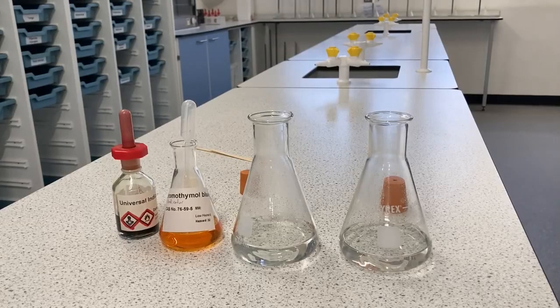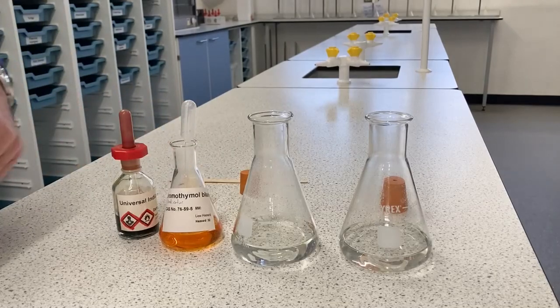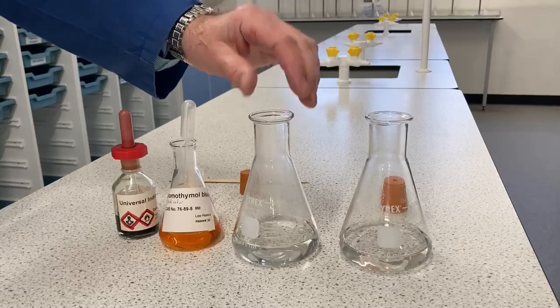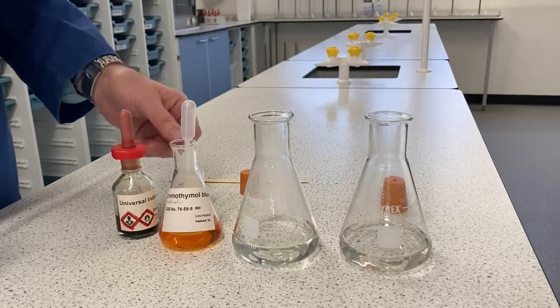In today's video, we're going to do some chemistry. We're going to look at how the combustion products from fossil fuels or natural fuels create acid rain. We've got two 250ml conical flasks, and they have about 100 millilitres of tap water in.